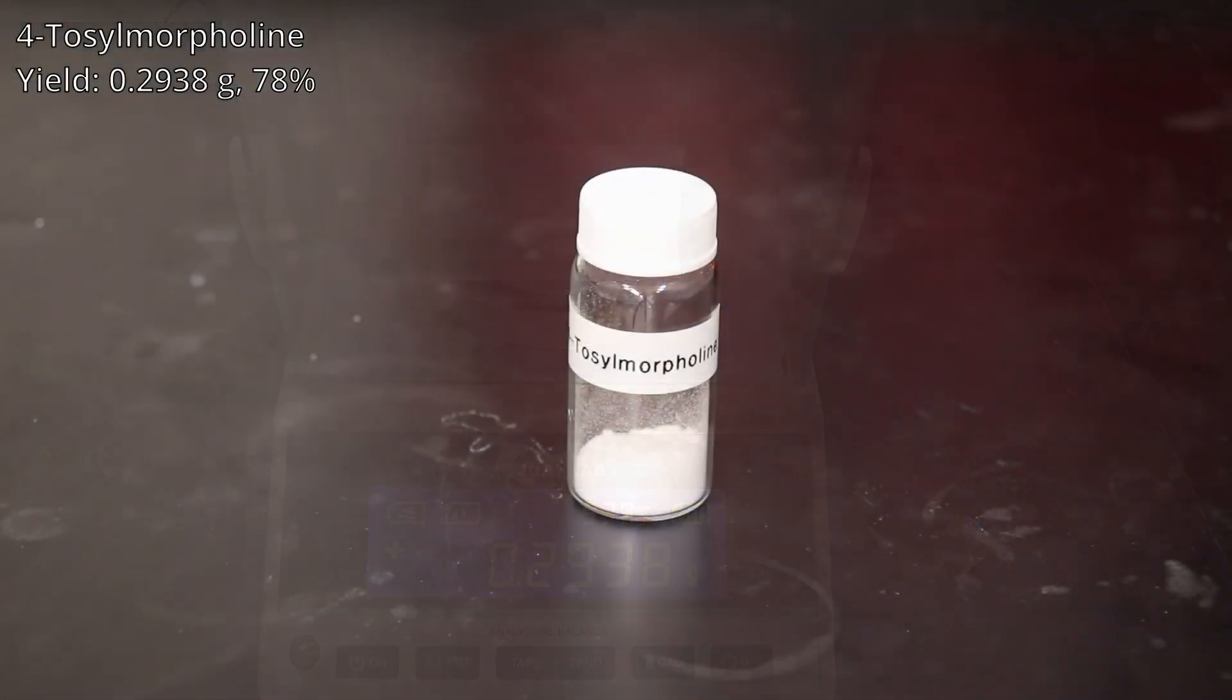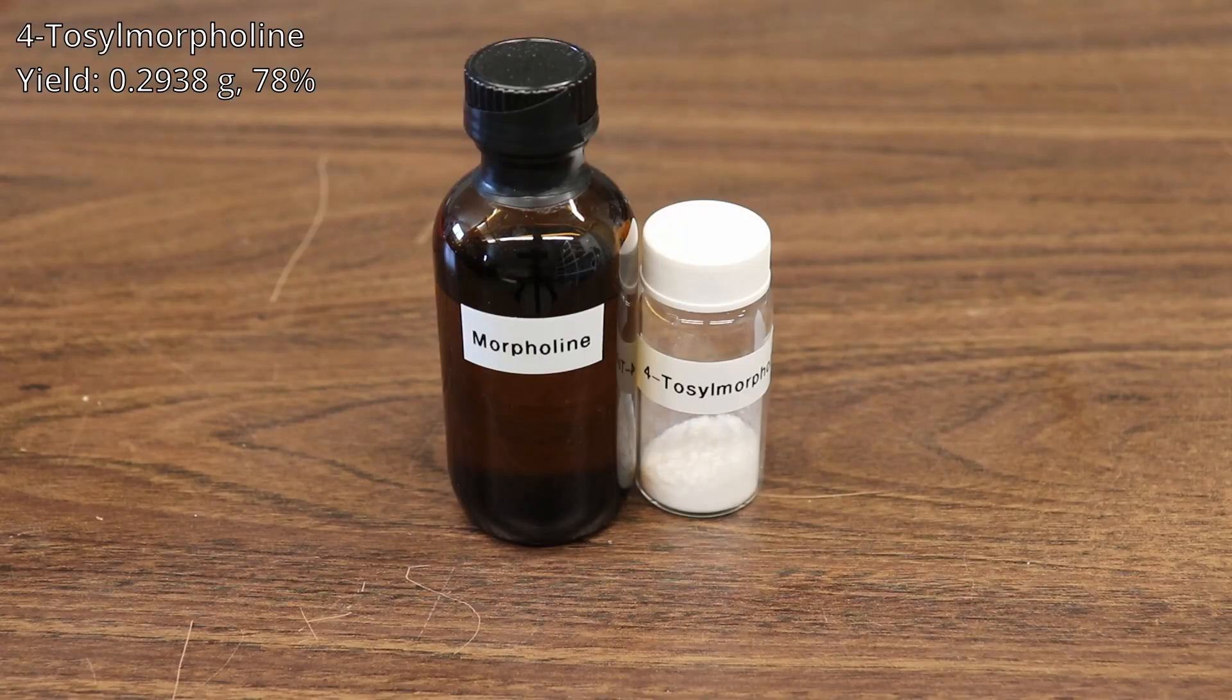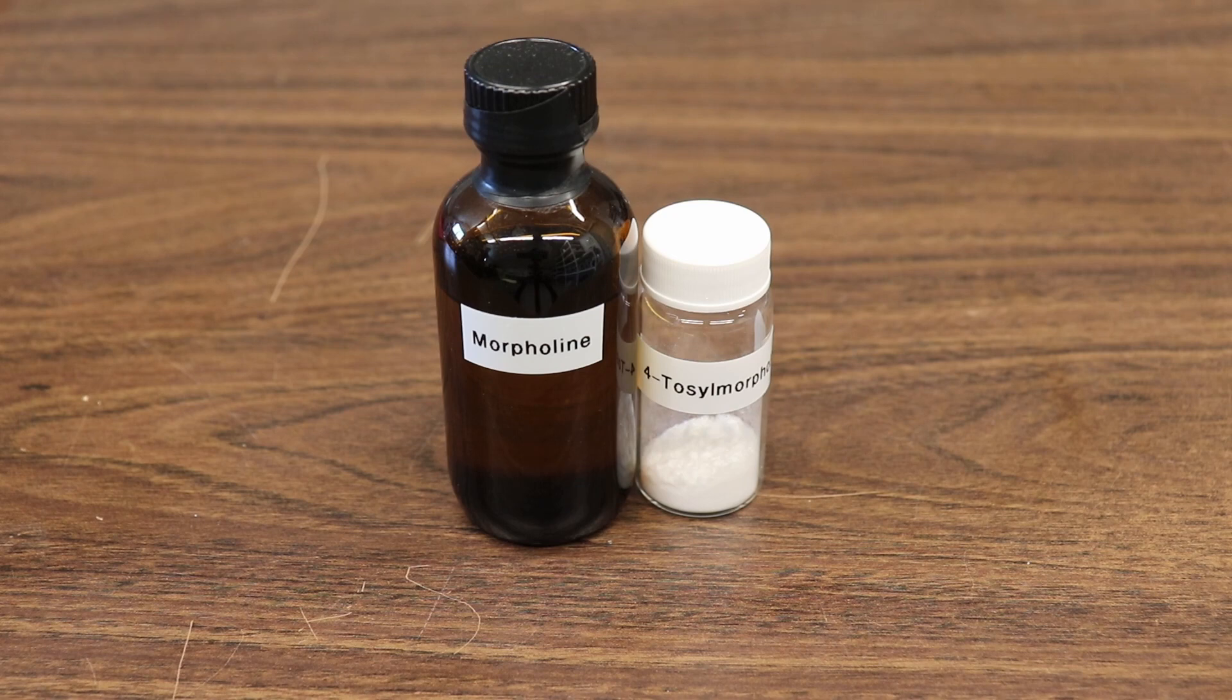0.2938 grams of the 4-tosylmorpholine was recovered, which corresponds to a 78% yield. This is by no means a quantitative test, but it does show that our product is substantially morpholine and that we had a successful synthesis.